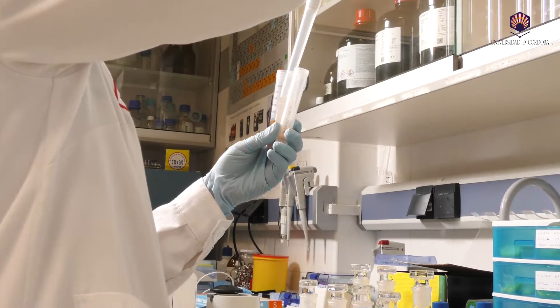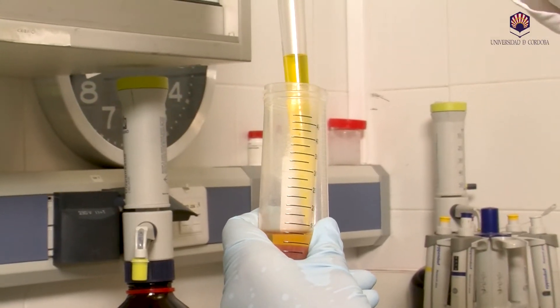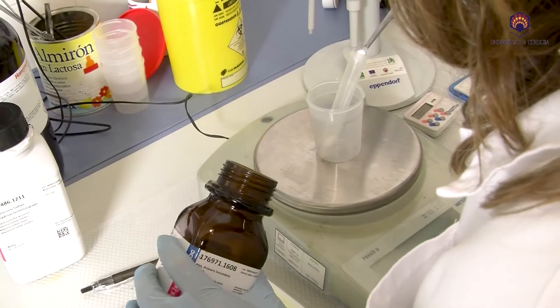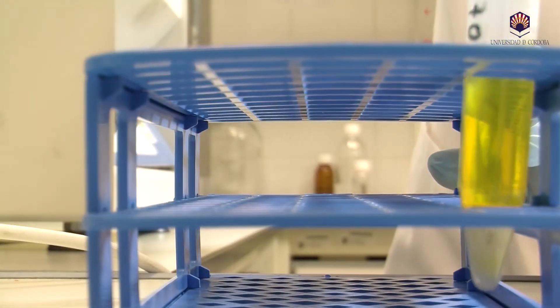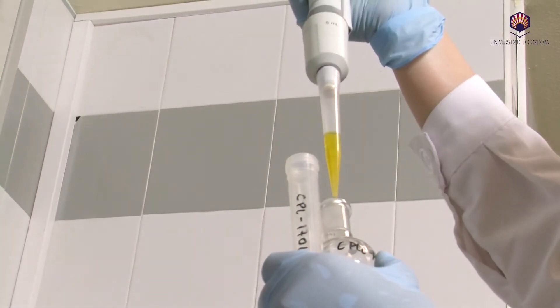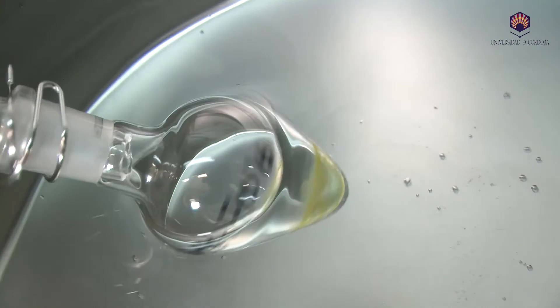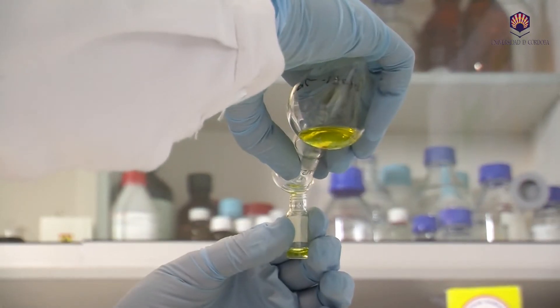In the cleanup stage, a 6 ml aliquot of the supernatant is taken and salts like PSA are added, which will eliminate organic acids, fatty acids, sugars and pigments that might have passed into the organic phase. Prior to the injection into GC-MS, an aliquot of acetonitrile — the organic phase containing the pesticides — is taken, evaporated and reconstituted in the same volume of cyclohexane/ethyl acetate mixture, since they have a lower boiling point, and thus the evaporation of the compounds in the gas chromatograph injector will be improved.